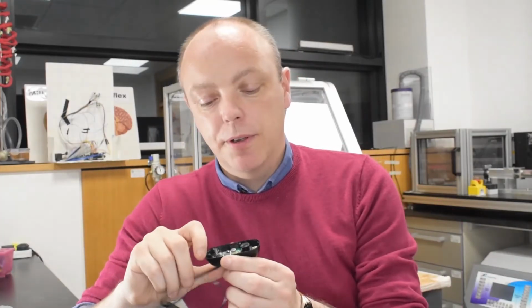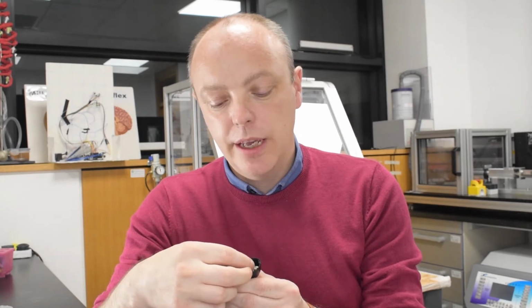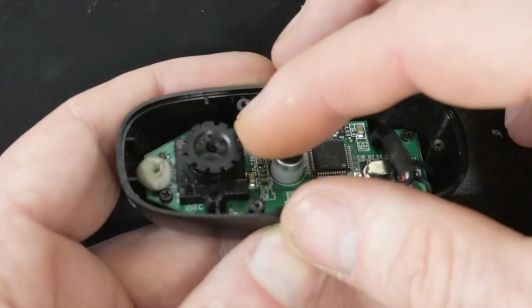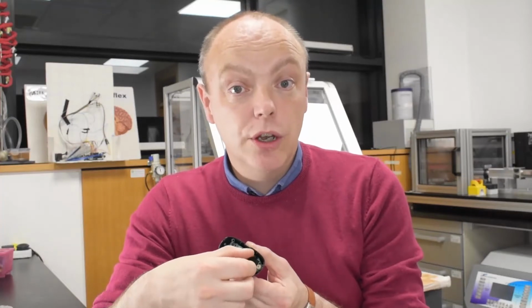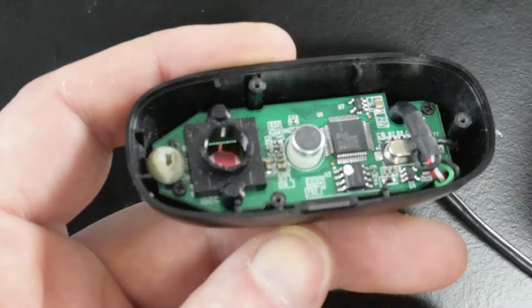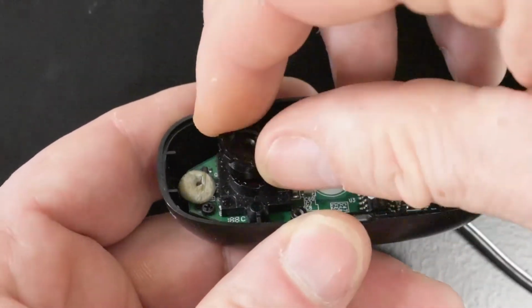But that's where this particular webcam gets quite useful, because when you take the casing off, the lens inside, which sits onto the sensor, is basically screwed into place. And what you can do, if you take the cover off, like we have here, is you can unscrew the lens. You can unscrew it and take it the whole way out if you want. That's what it looks like, that's the sensor inside.